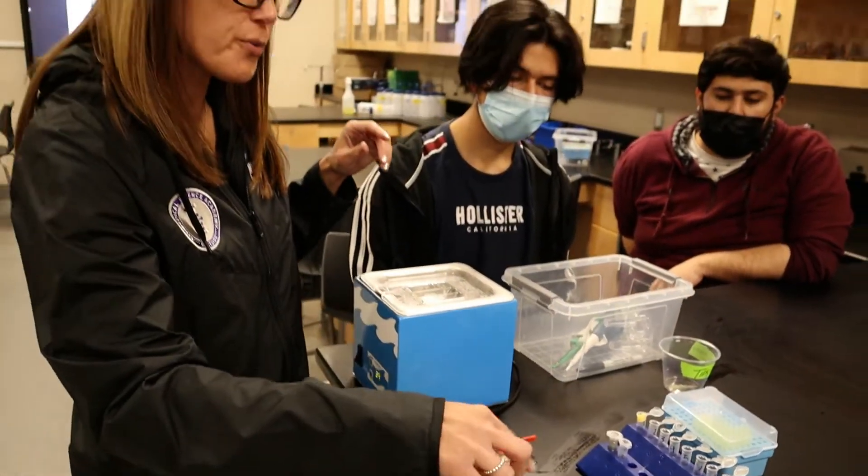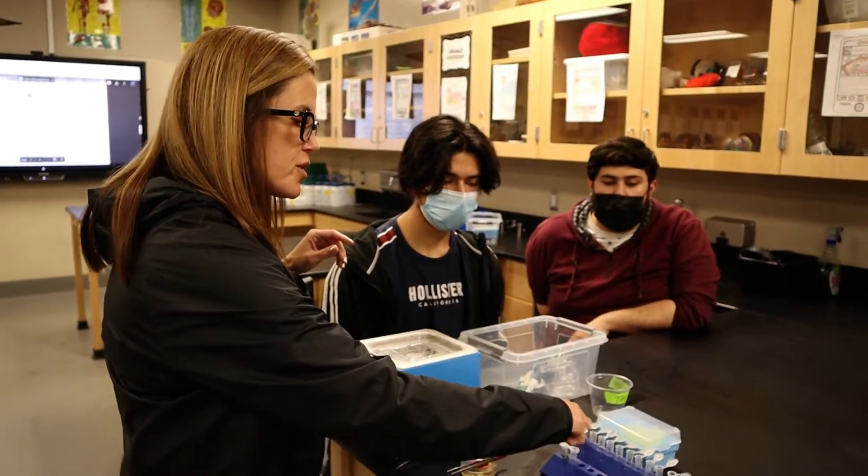So I did one — if you guys could do two, three, four, and five. So you'll just do the first five tubes, the others will be empty.